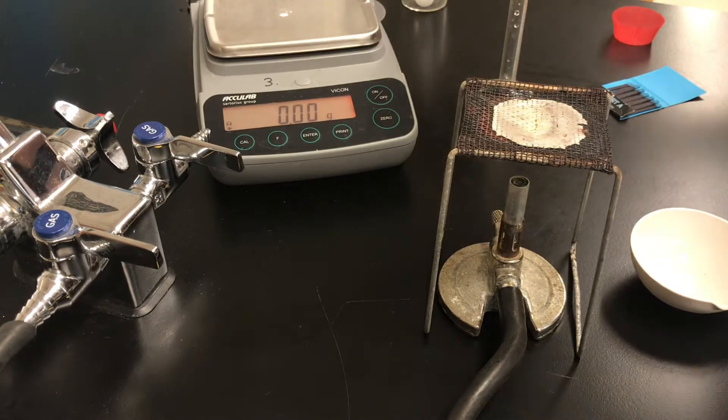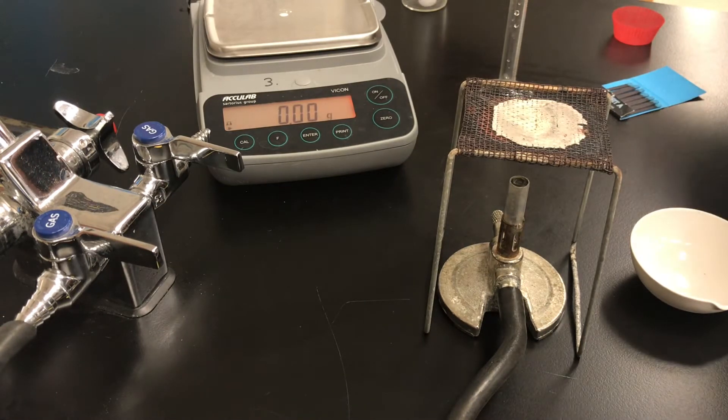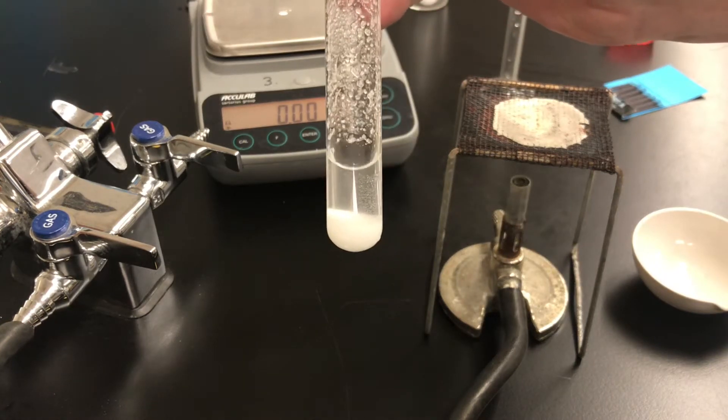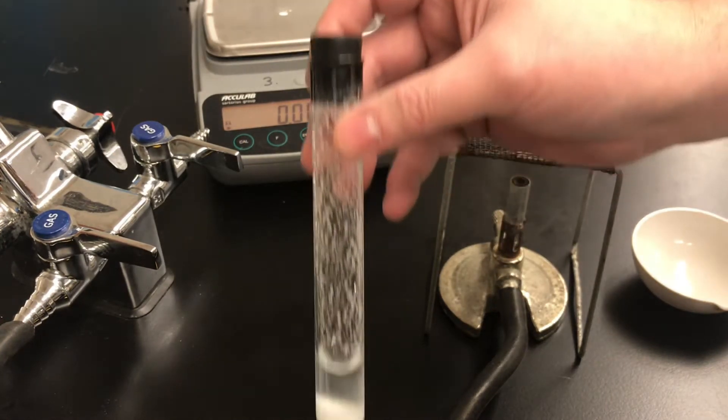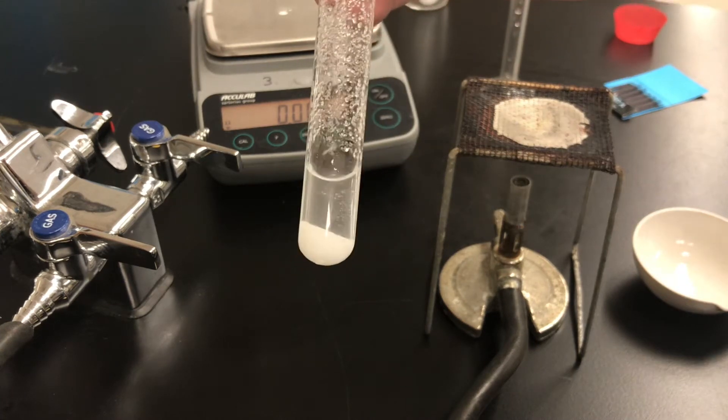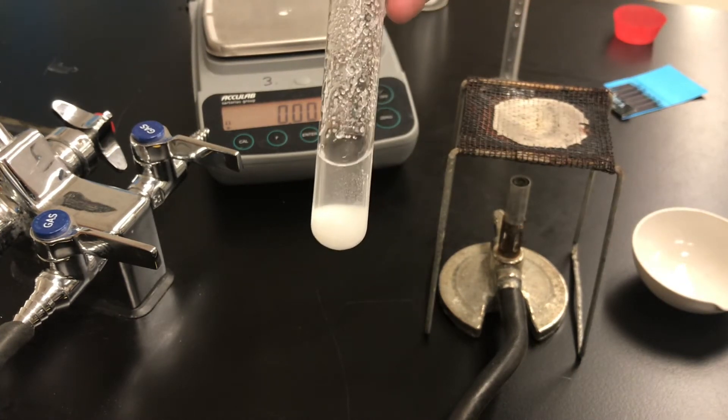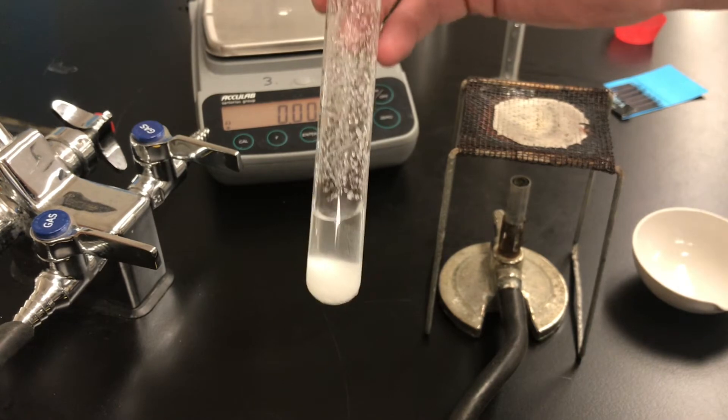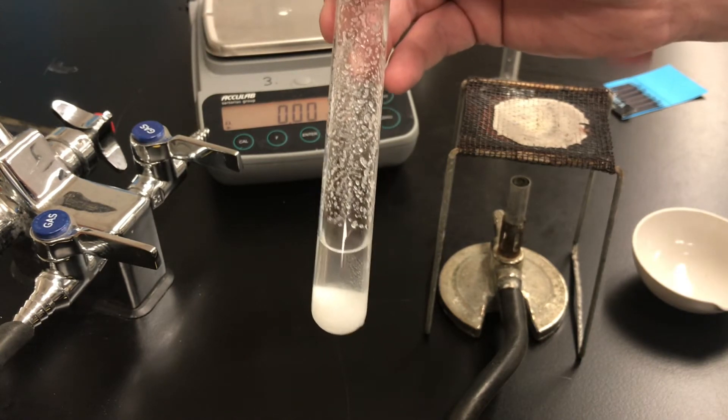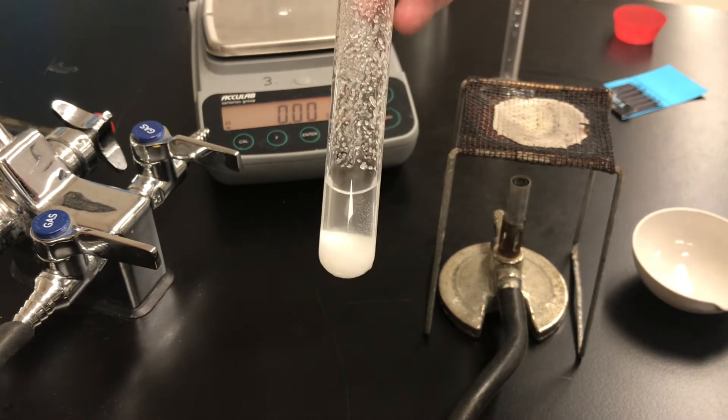Now I've got another test tube already prepared. Here's another test tube that I've been shaking for about five minutes and you can see that in this test tube there's still undissolved salt at the bottom. That's important. If all of the salt had dissolved then the solution would be unlikely to be saturated.